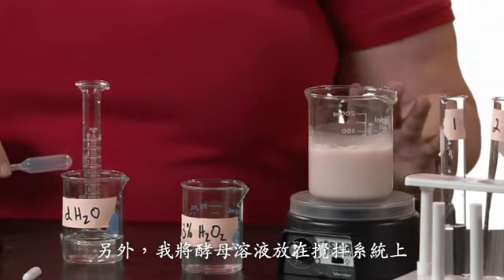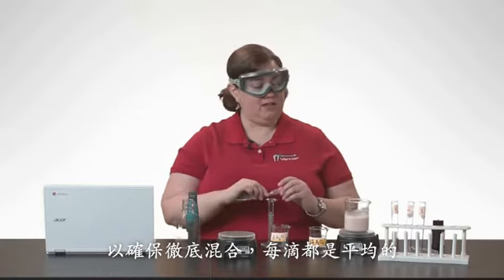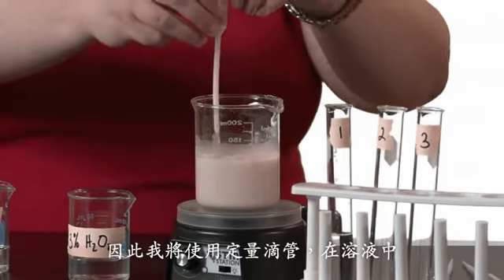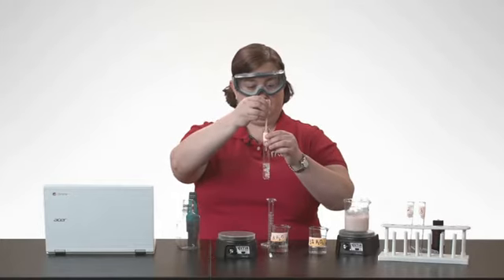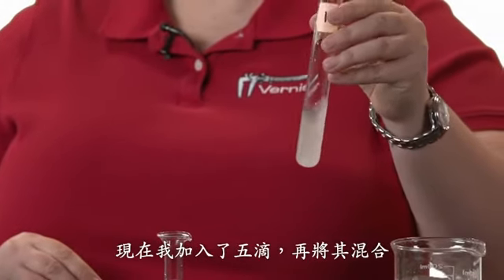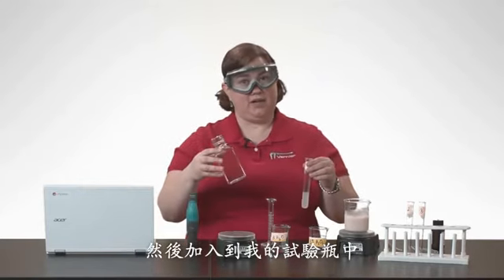Also, I have my yeast solution on a stir station to ensure that it is thoroughly mixed and that I get an even amount of yeast every drop I take. So I'm going to use a pipette and take from the center of my solution, and I'm going to add 5 drops. Now that I've added the 5 drops, I'm going to mix it a little, and then I'm going to add this to my Nalgene bottle.